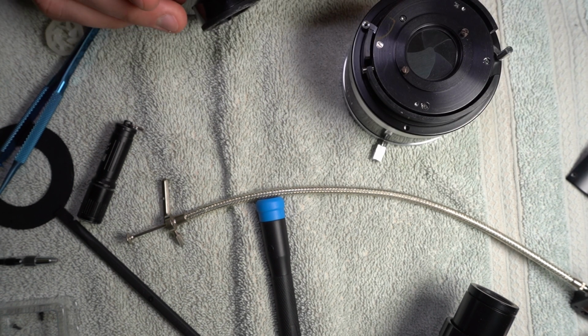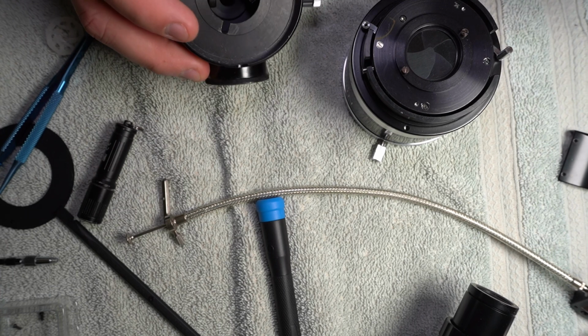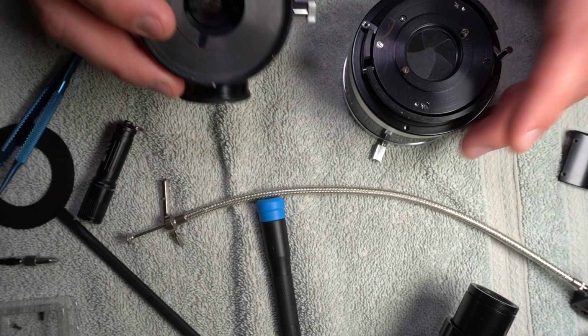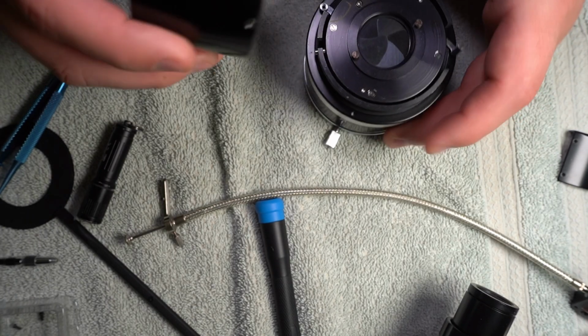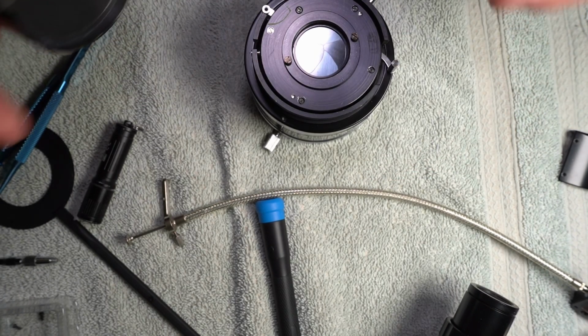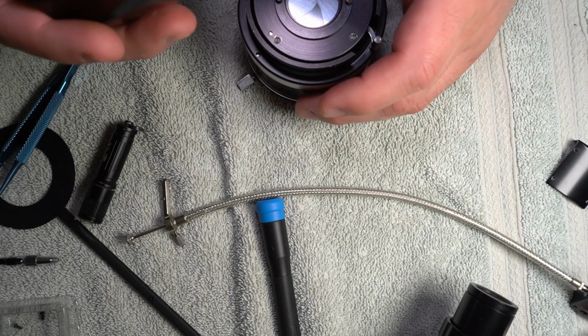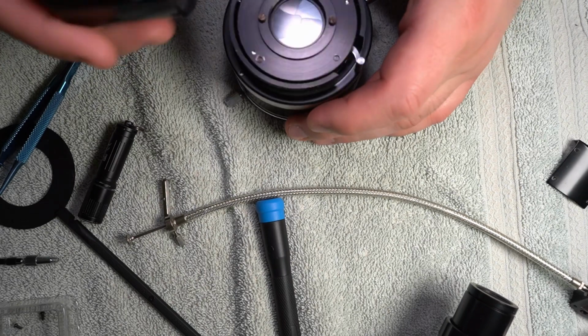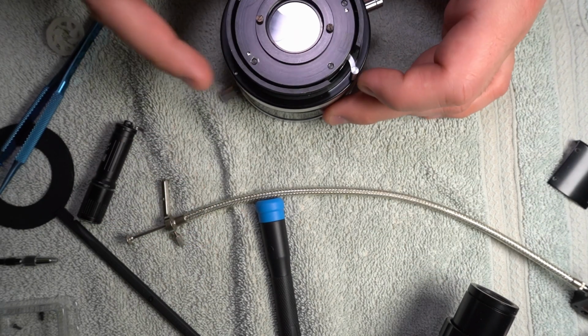See, I didn't film this taking it apart, so I'm not positive where those go. Oh, okay, I know where they go now. Whew. Okay. Yeah, so I kind of did this out of order. I didn't realize I had to take a part off when I did. Okay, so now you can see this. There's this thing here, and it literally just hits this pin, and that's its whole job.